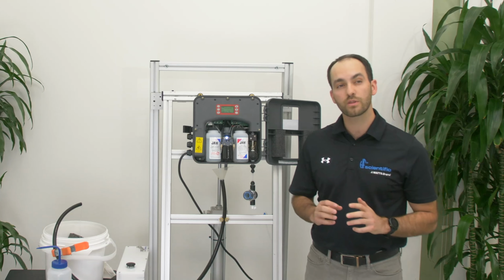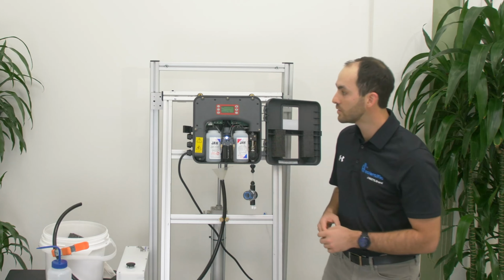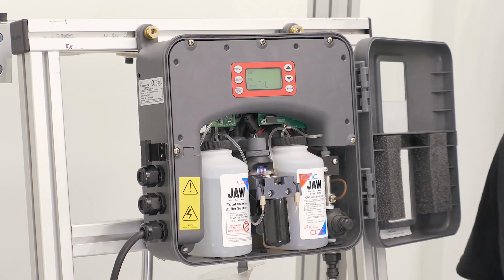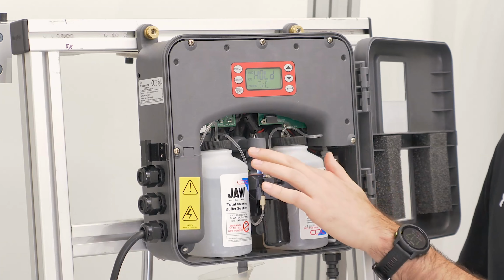We're going to check one more thing to make sure that we don't have any leak by from our intake solenoid. We are again going to go into the hold mode by pressing the service button and waiting for the screen to say hold. At this point in time, we should have no water inside the cuvette.